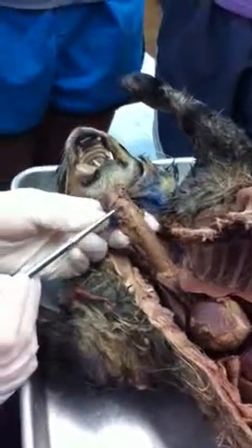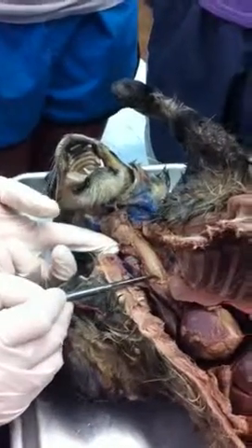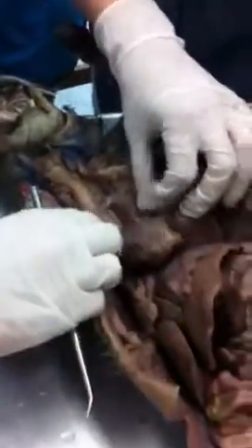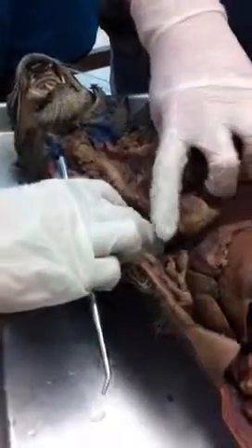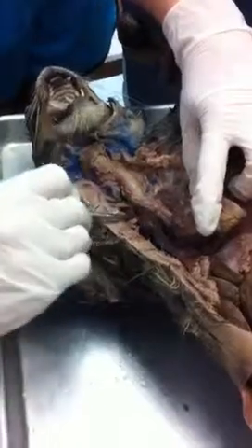Larynx. Okay. So it usually sits like this, larynx, and then we have the trachea. And then where are we going to go? Once we bring in air, where are we going to go? Primary bronchi. The primary bronchi is the first split into the left and right lobes of the lung, or the left lung and the right lung.